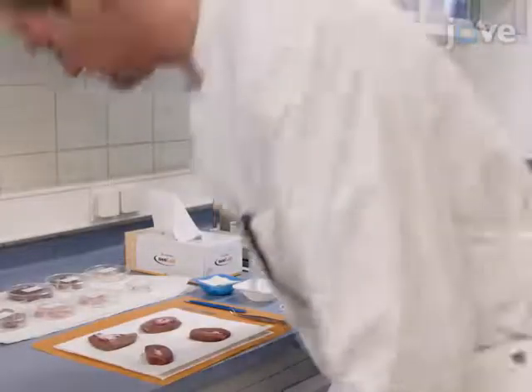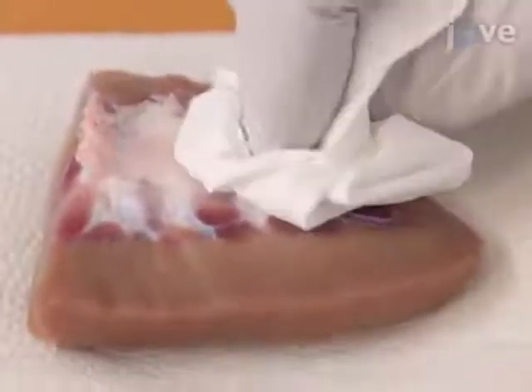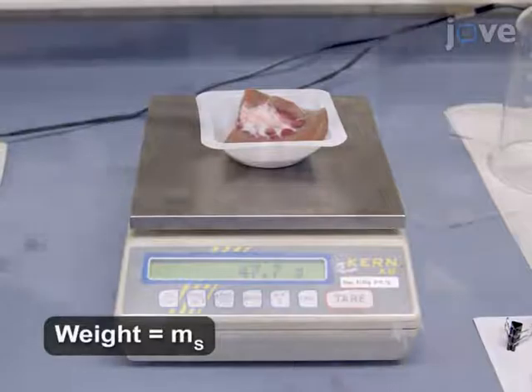To begin volumetry for a large organ, excise an appropriately sized piece of tissue from the organ. Carefully swab the sample with a paper towel to remove excess blood and tissue fluid. Then weigh the sample on a precision scale and record the weight of the sample.